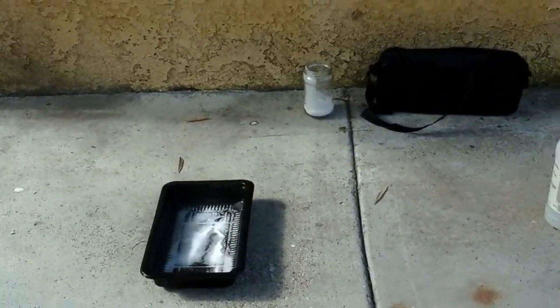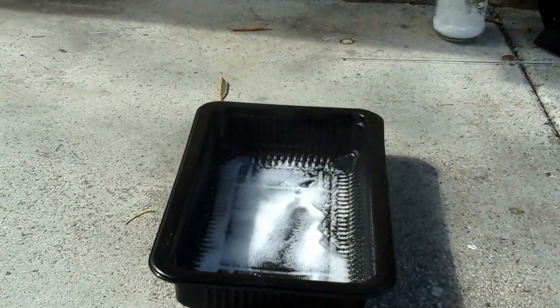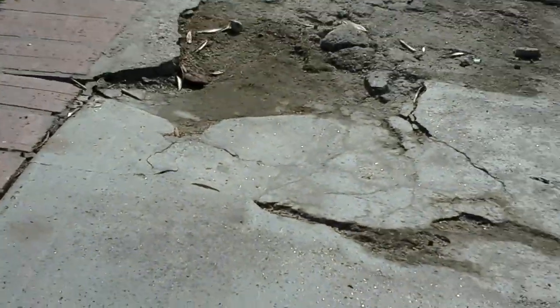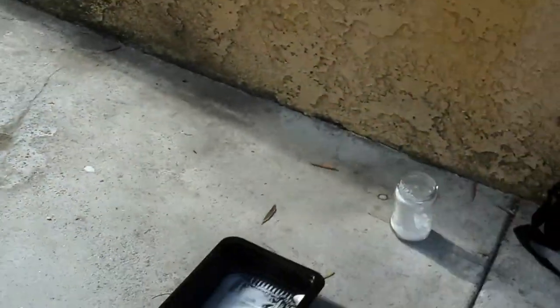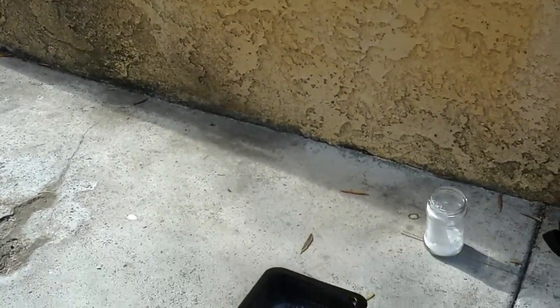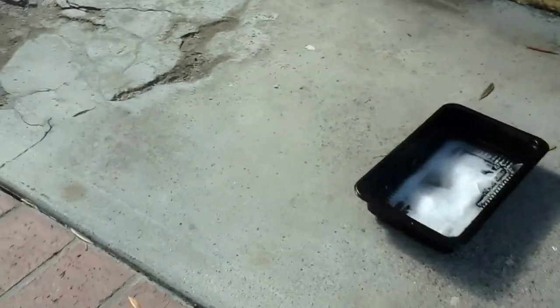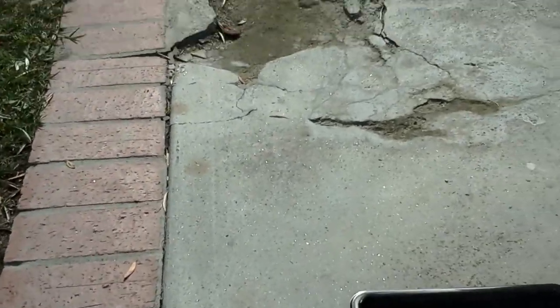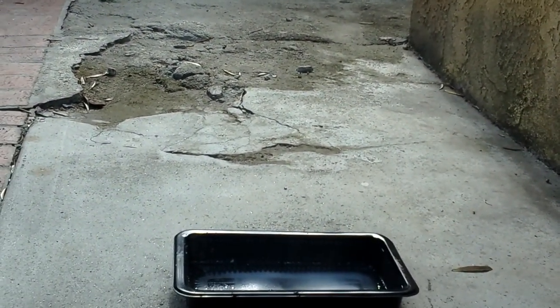I don't think the camera is picking this up, so I'm going to add more — hopefully you can pick this up. And there you go. Maybe you could see those fumes — I see a lot of clear fumes.